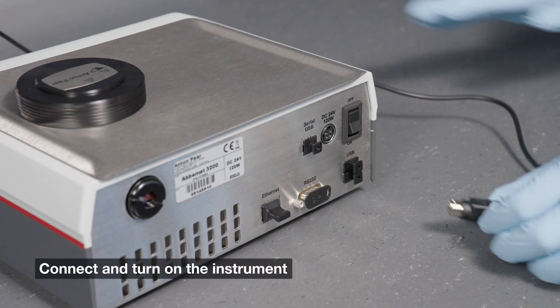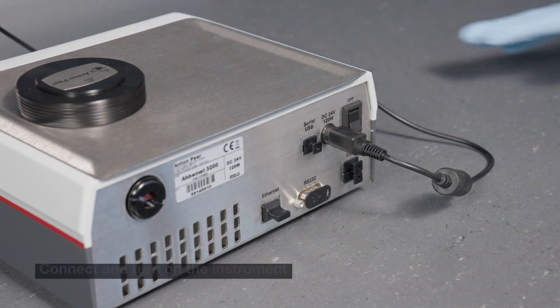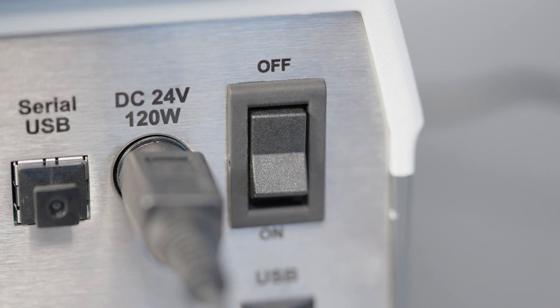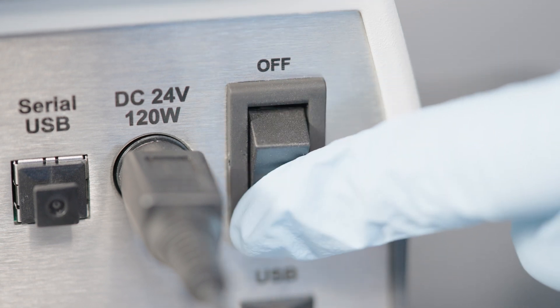Connect the external power supply to the instrument and plug the power supply into a mains outlet. Ensure the power switch on the rear of the instrument is off while connecting. Turn on the instrument.